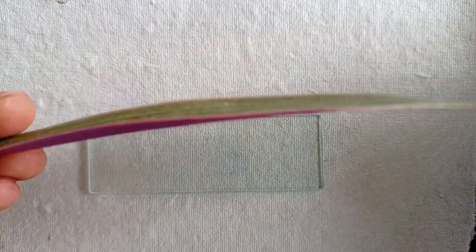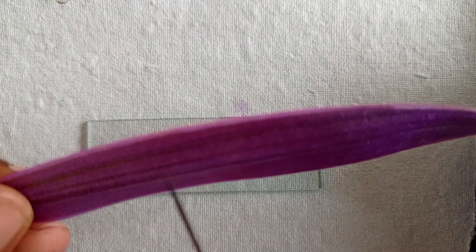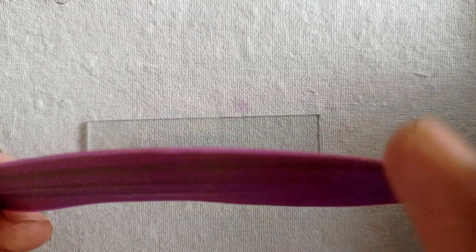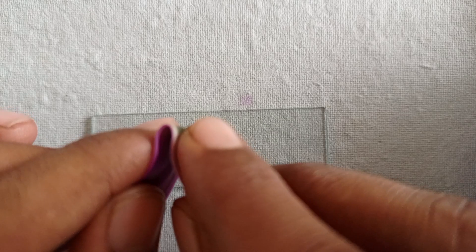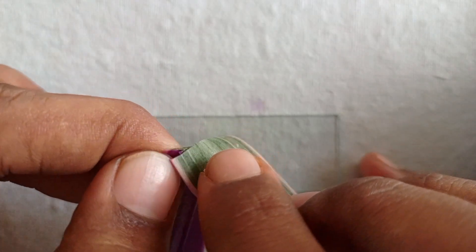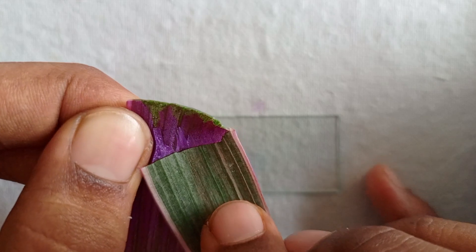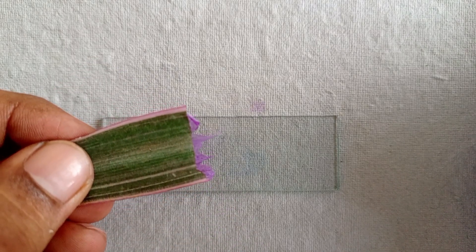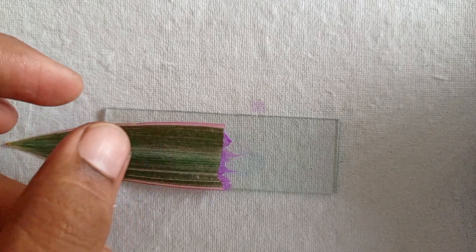Let's see the procedure. Take a clean glass slide. Here we have taken a real leaf sample to observe the stomata under the microscope. This is the upper surface of the leaf which contains the upper epidermis, and this is the lower surface which contains the lower epidermis. Fold the leaf in this direction and slowly tear it to get the lower epidermis. Just tear the leaf so we can see the lower epidermis. Now cut a small piece with the help of a sharp blade, taking a small part of the epidermis.